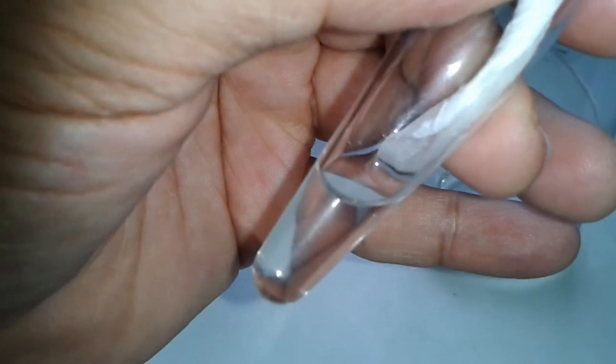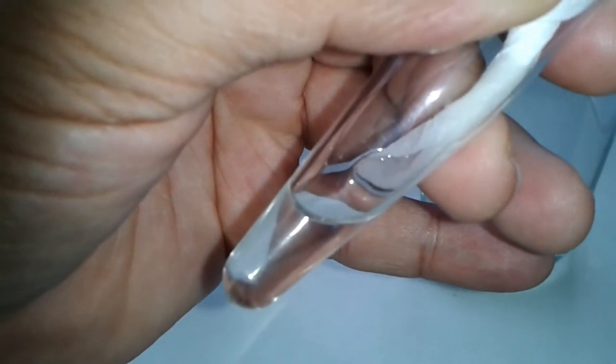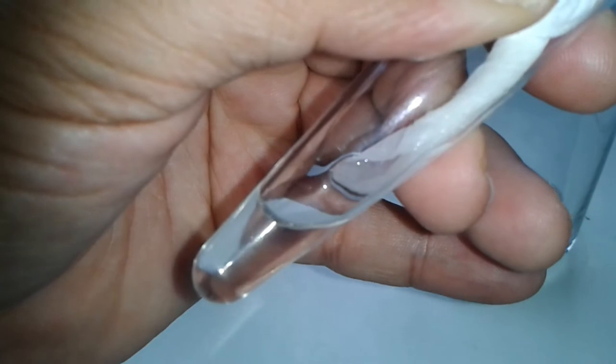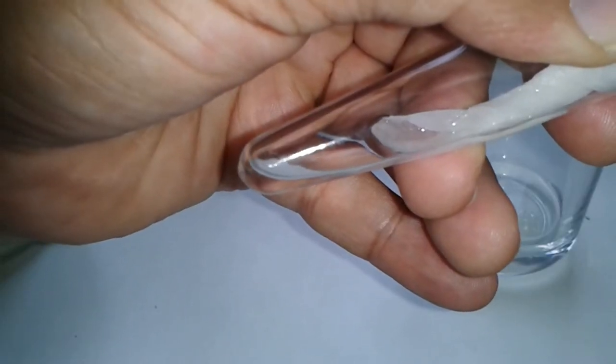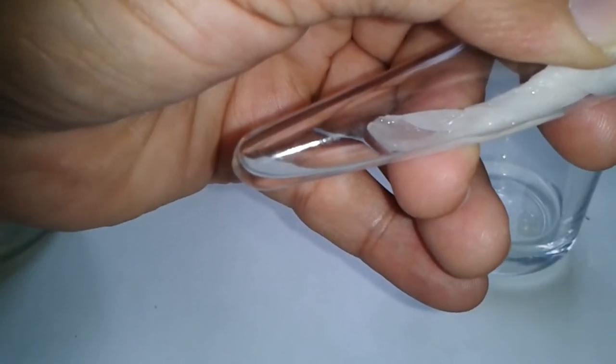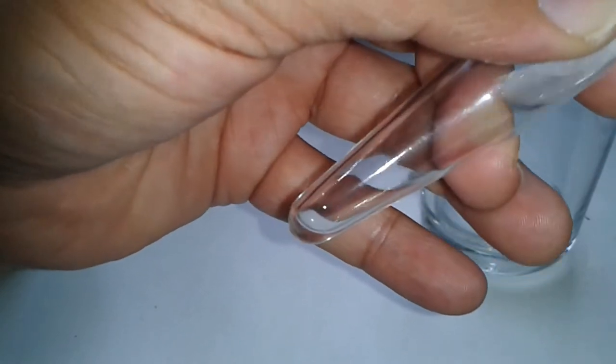Unfortunately, my pipette was not long enough. So I'm now removing more water with some tissue paper. So I need a longer pipette, obviously. And I'm leaving a little bit of water behind, maybe half a milliliter.